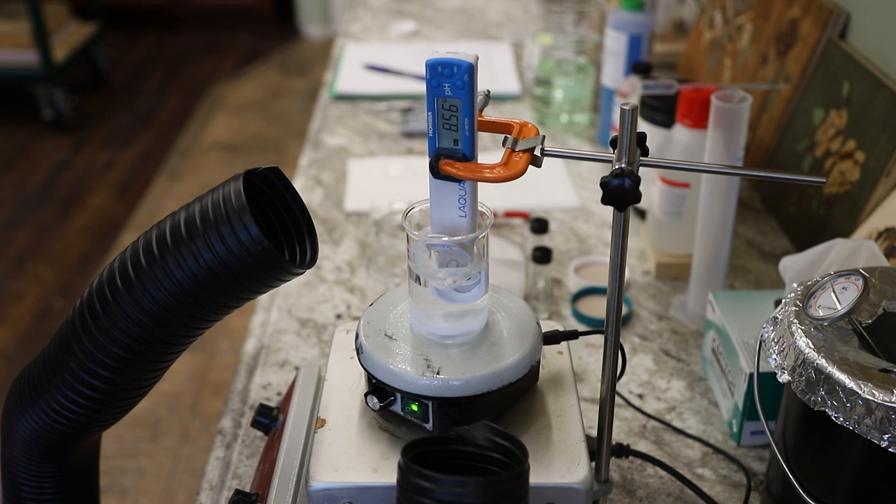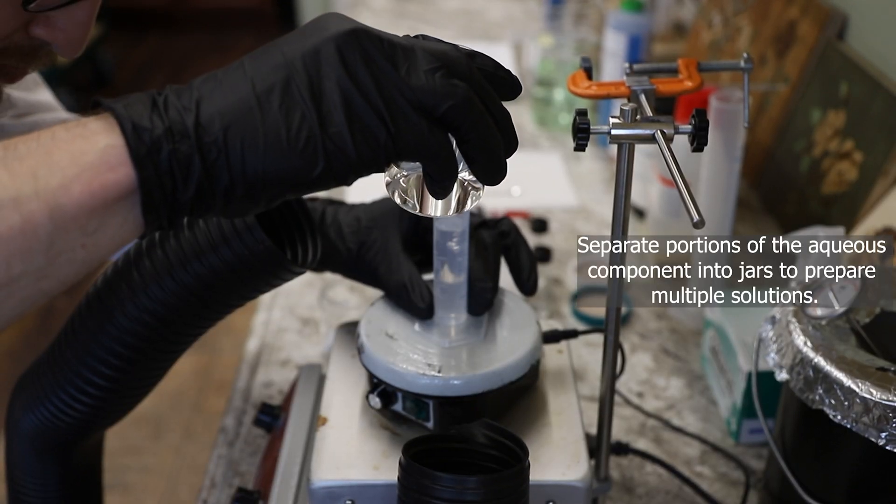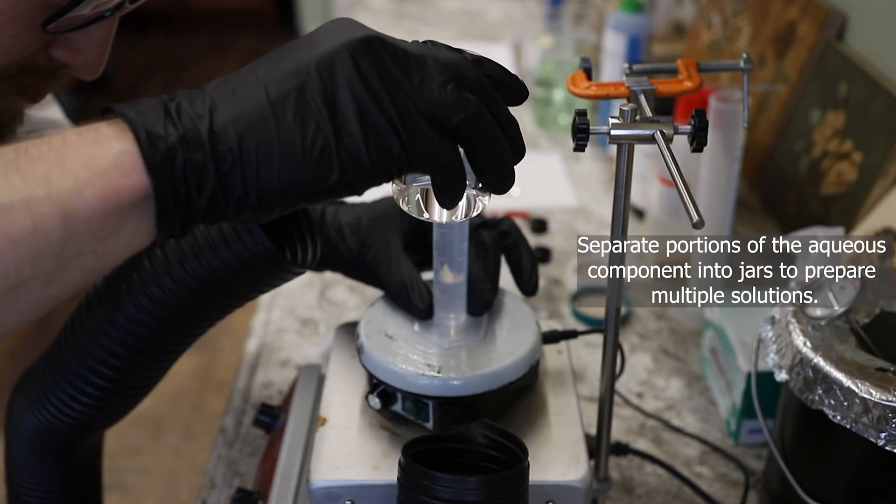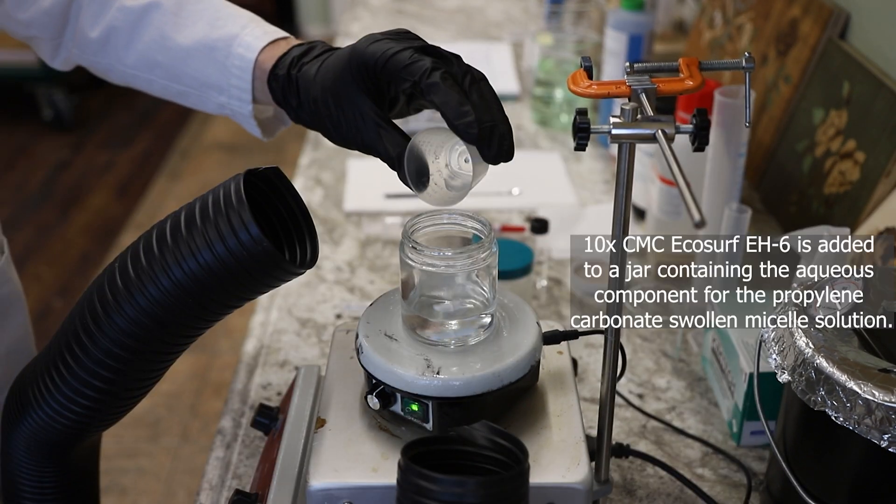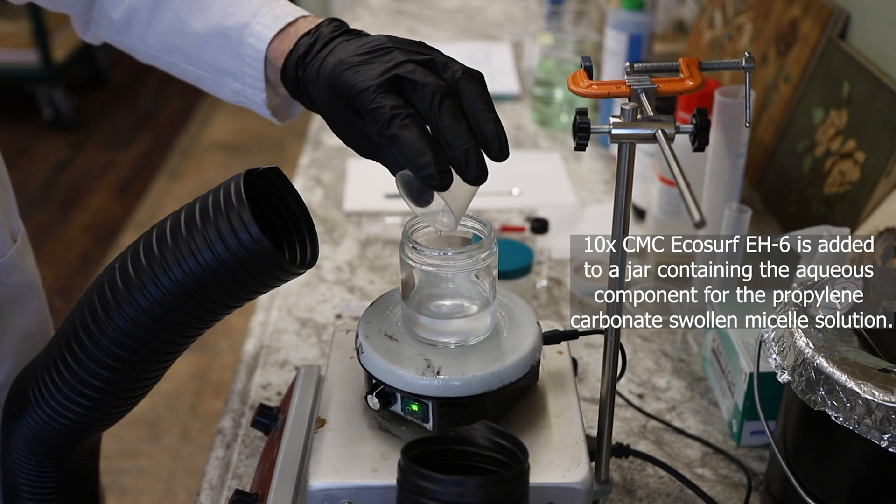What does change are the solvent amounts, solvent type, and surfactant amounts. So what I'm doing is just taking that aqueous component and putting it into a jar, and then I can prepare each separate solution in each separate jar.